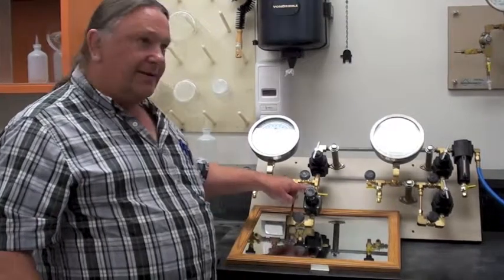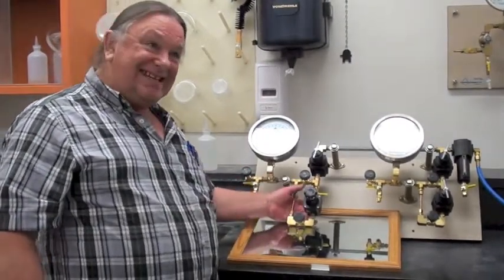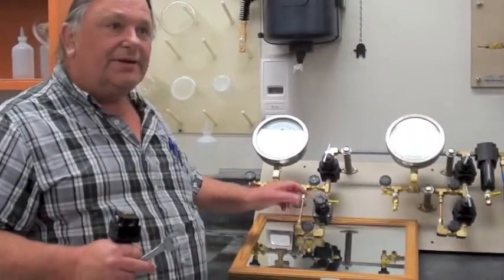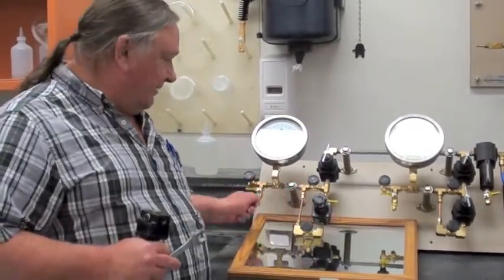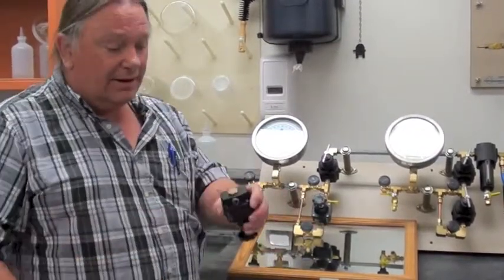You're not isolated out right, you've got this off and on, or because of ram pressure, the seat got knocked out of the back. Okay, if you ever get the situation where this is leaking all the time, that's off, and it's still leaking, the suspicion is that ram happened, the seat in the back came out, and I'll show you how to put it back on.